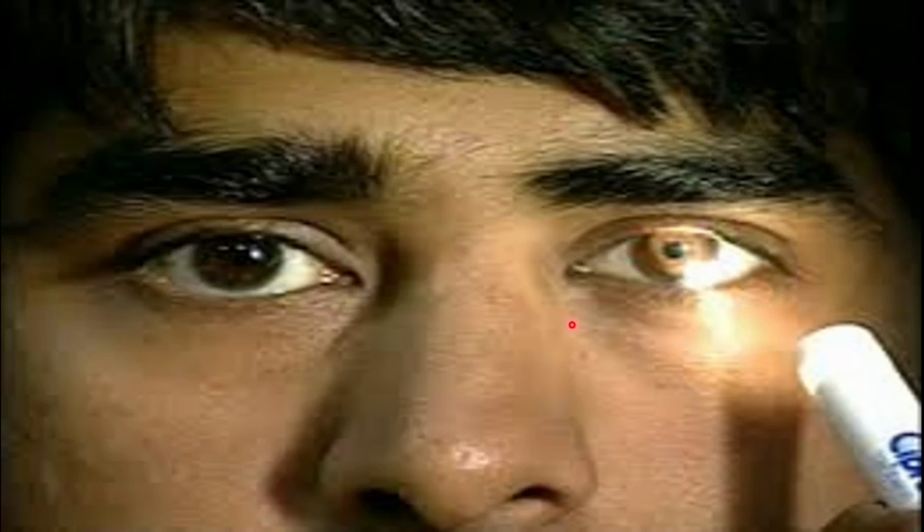So all of you must know that if light is shown to the eyes, the pupil constricts. The pupil constricts so as to limit the entry of light inside the eye. And when you go into a dark area, the pupil will dilate, so that more light enters the eye and you can see things clearly. So the pupil is regulating the entry of light inside the eye, so you can see things in the light area or in the dark area accordingly.